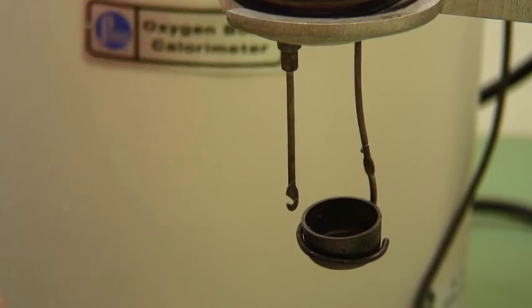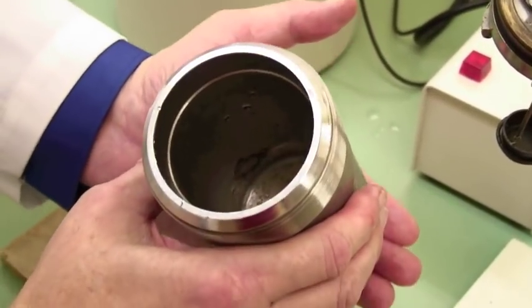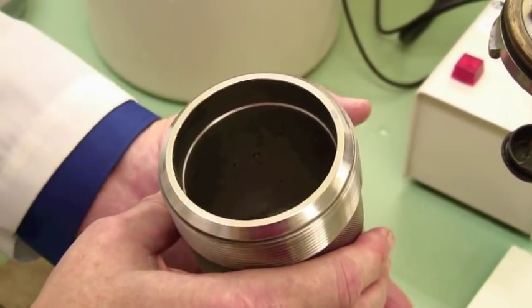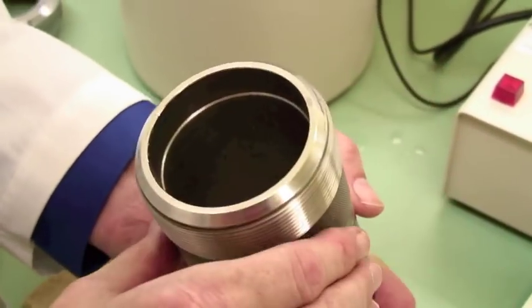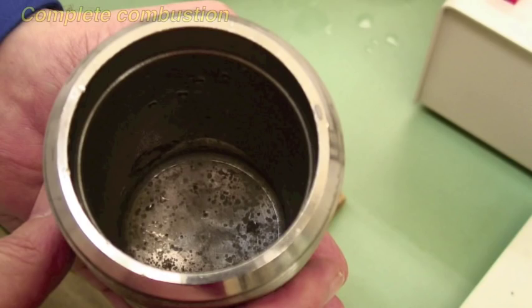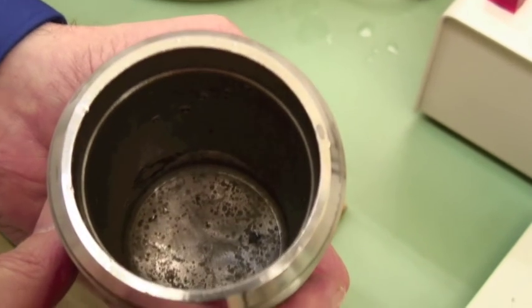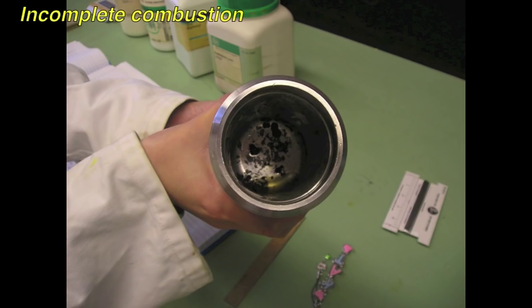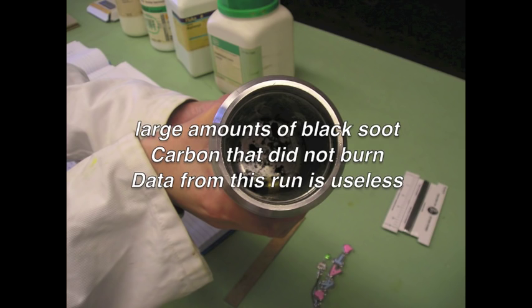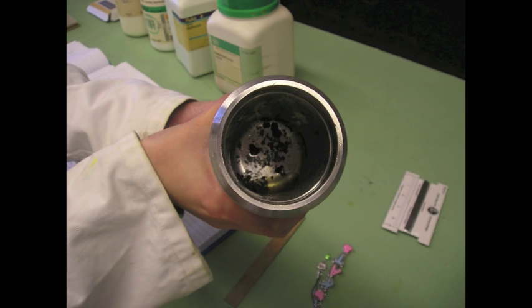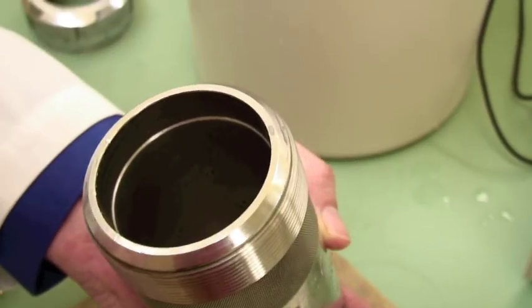Now I'm going to hold this up and show it to the camera. This is a good burn. And the thing that's good about it is you don't see anything. It's just some water, some bubbles, and some black stuff, some little bits that look like black gravel. The small black dots are in fact fuse oxide. The bubbly water is oxygen bubbles in the water itself. What you do not want to see at this point is soot. You sometimes get bomb firings that leave you with black soot lining the container. It looks as if somebody has taken a candle and lined it up with soot. In that case, you didn't have complete combustion and your run is trashed. This one was just fine.